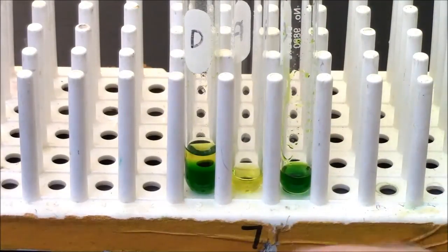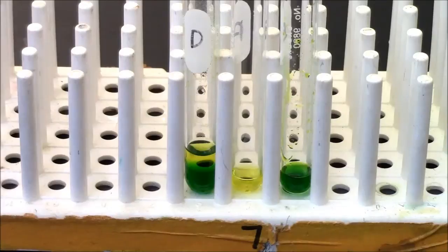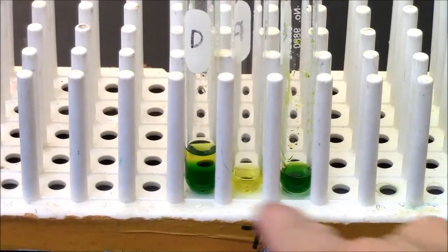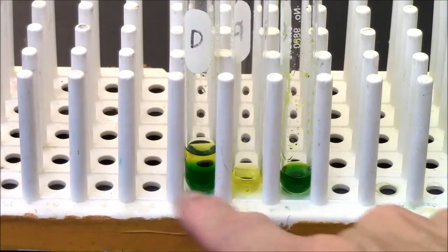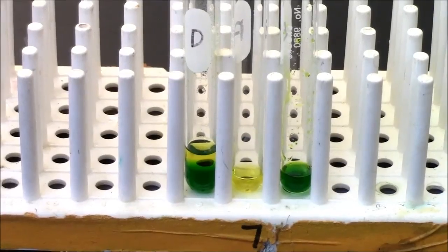If I try to get everything, then it's likely that I'll get a little bit of the other color that I don't want. So depending on what's more important, purity or yield, do the right thing. Thank you so much.